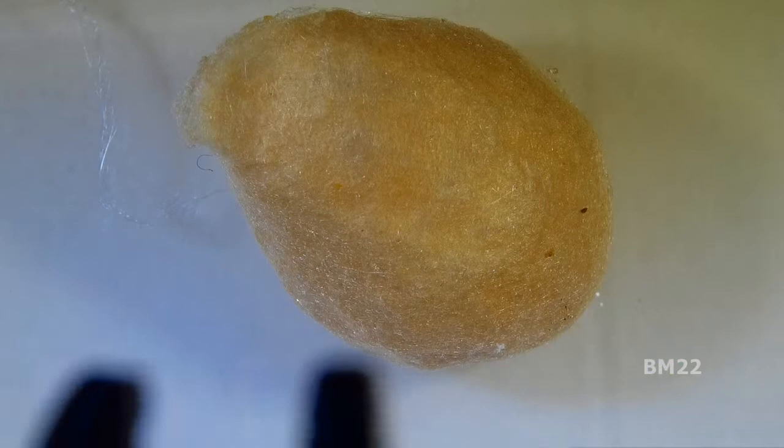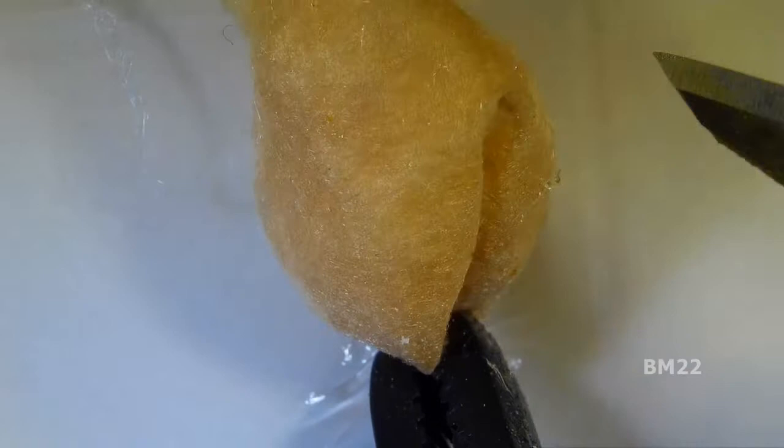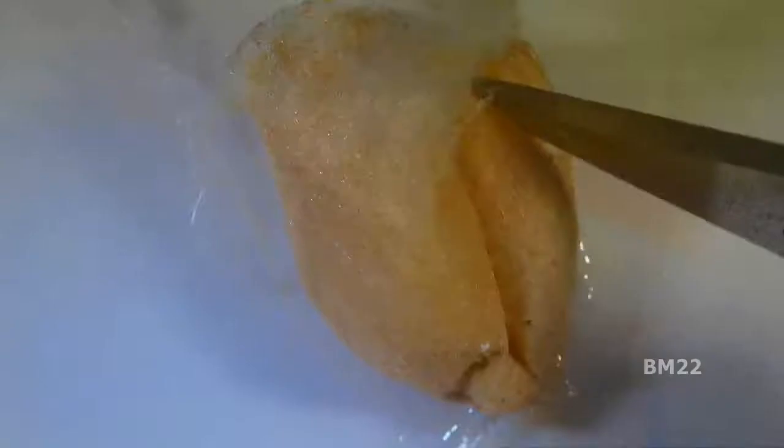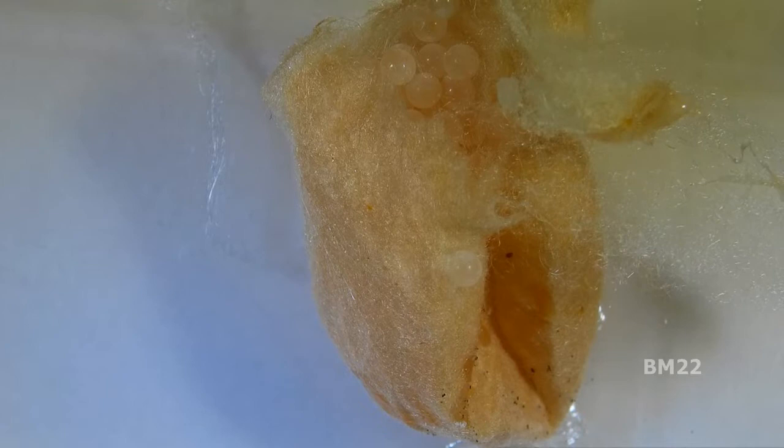We'll open it under secure conditions under that microscope. I call it a microscope but it's not — it's a video magnifying thing that looks like a microscope, but you're not going to look at germs or teeny tiny microscopic things. These are made for looking at circuit boards. They still call them a microscope. Anyway, we haven't fired up the old KK Moon microscope in a while.